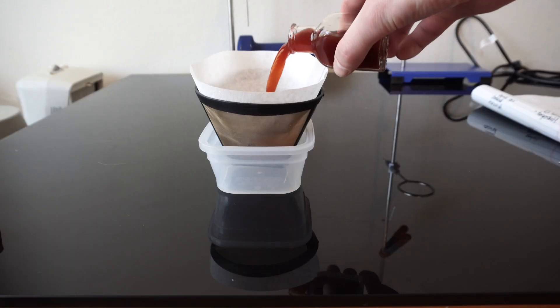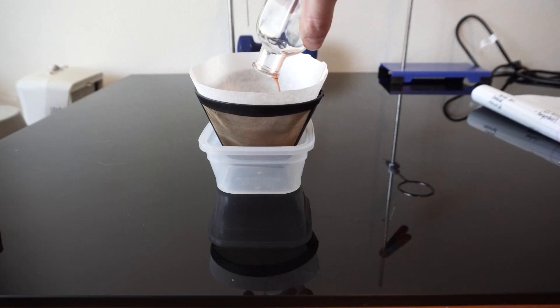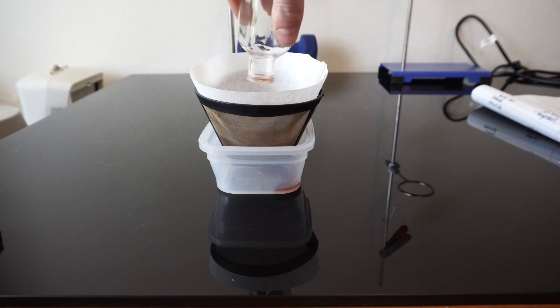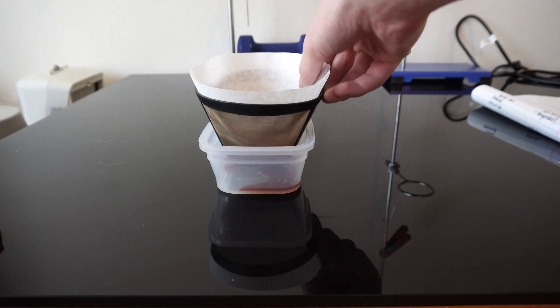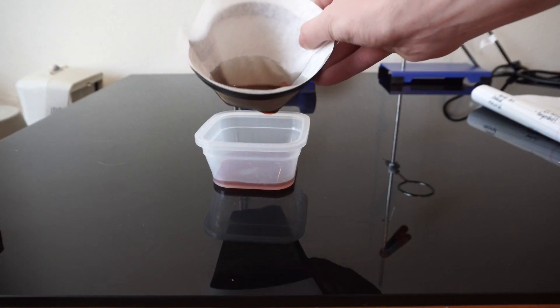I then dump the boiling flask into smaller jars before running it through coffee filter to remove any smaller particles still remaining, which is then poured back into clean vials.